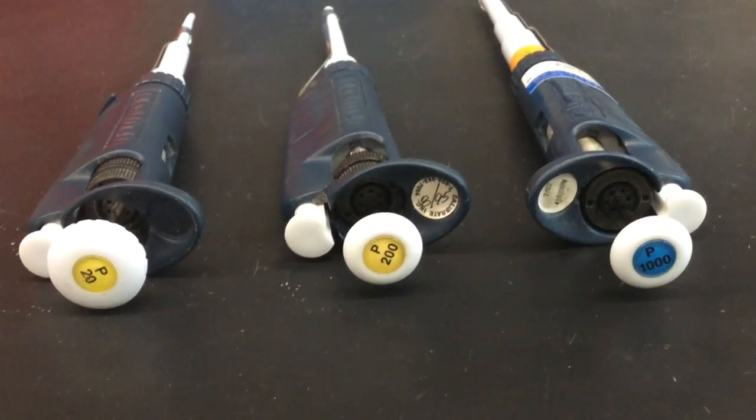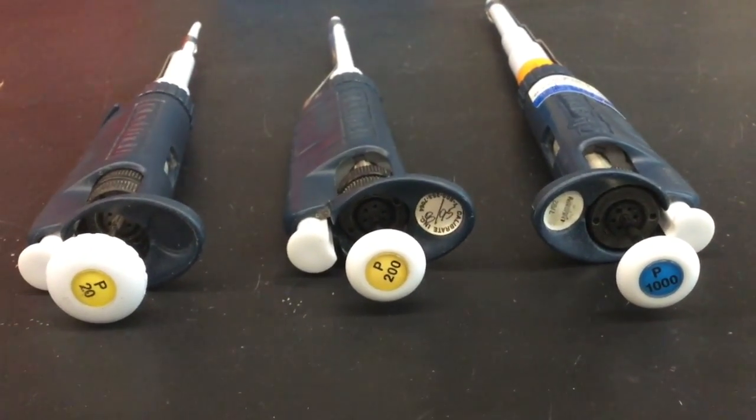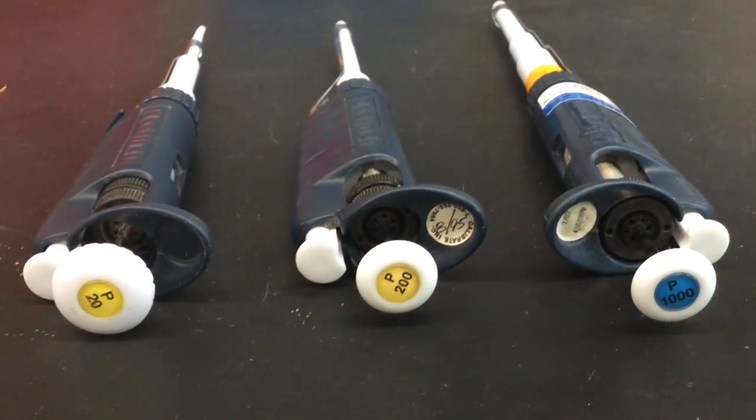Now that you have learned these techniques, make sure to implement them properly when using a micropipetter in the laboratory.